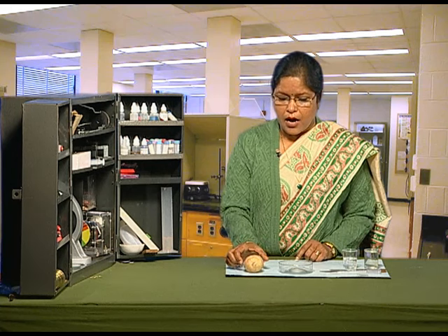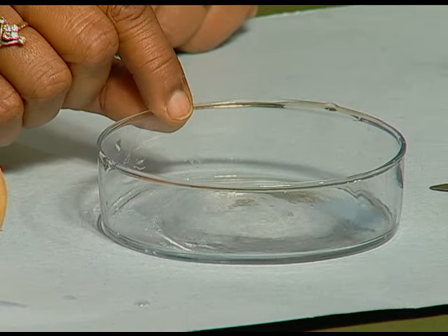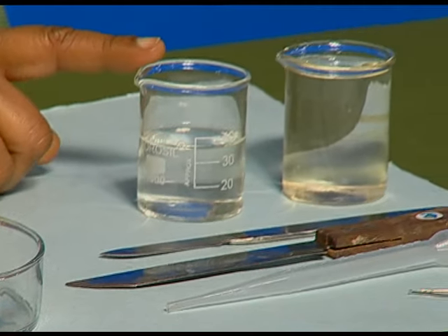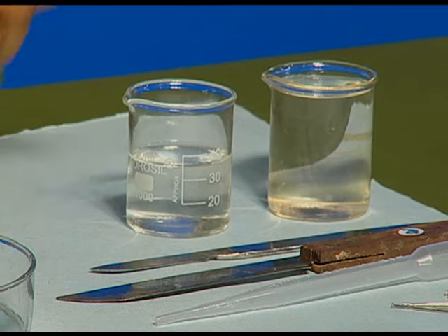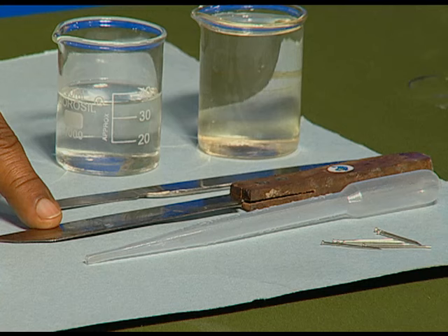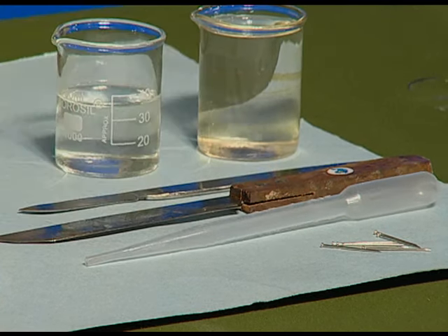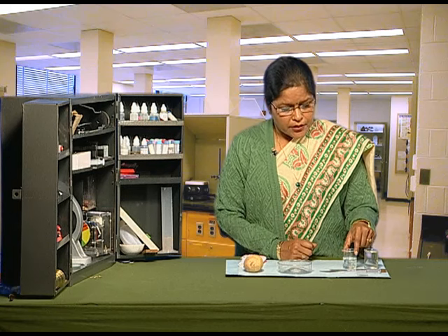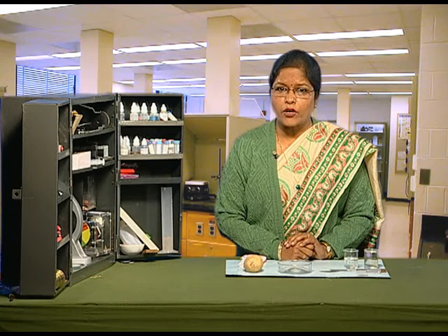For this, we require a potato, a petri dish, 3% sugar solution, water, scalpel, knife, dropper, and pins. 3% sugar solution means 3 grams of sugar in 100 ml of water. We have prepared this already.